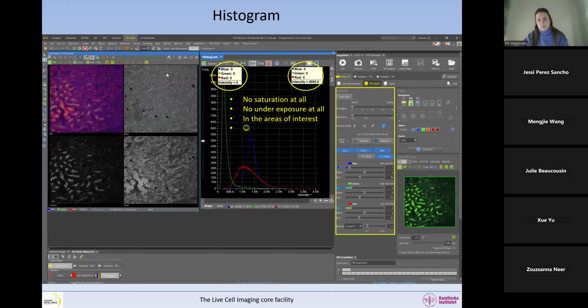If you have a big blob of antibody that is here, and this is not in the area of interest, it's okay if that bit is saturated. What we want is no saturation, no underexposure in the areas of interest. And even if you have to publish this image, you can always say the big blob on the top left of the image is precipitate from the antibody and was not included in the analysis, or something like this. It's fine. As long as you can explain, there's no problem with having a big blob that is saturated. Just say it. So in the areas of interest, no saturation, no underexposure.